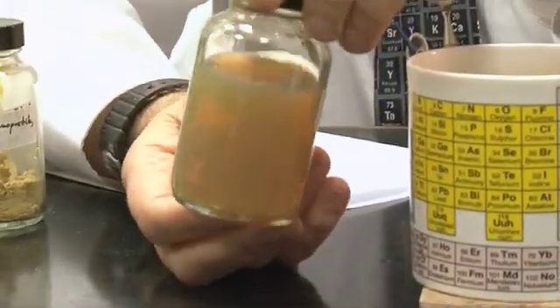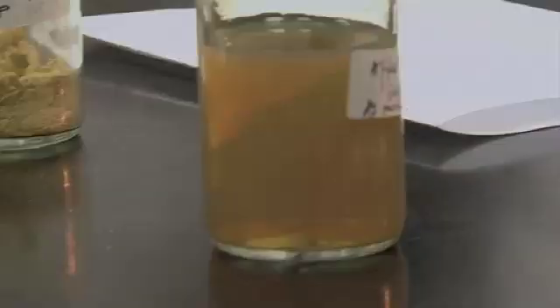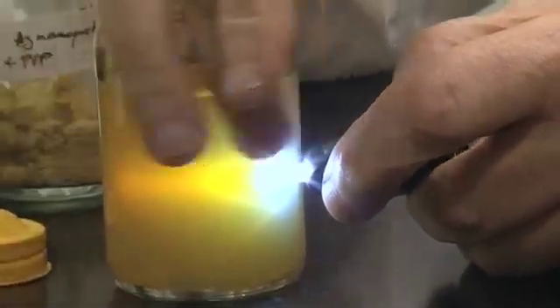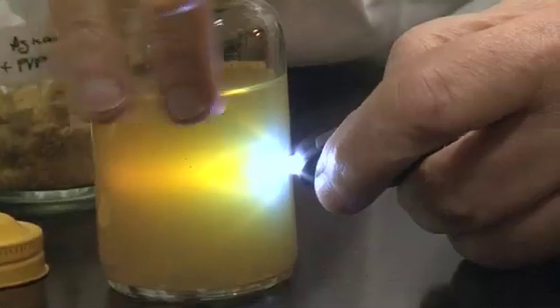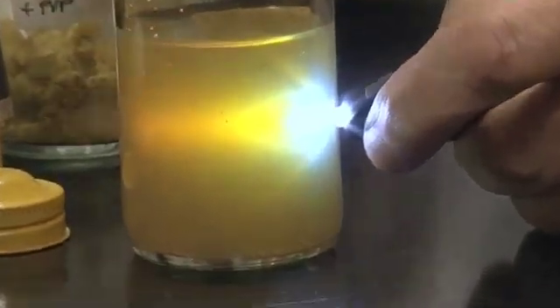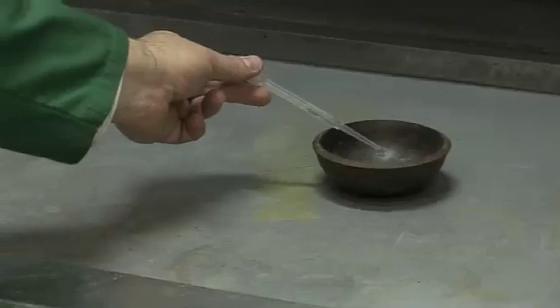Here I've got a solution of silver nanoparticles — you can see it doesn't look silver, it looks a bit yellow actually. You can tell it's got particles in it because if I shine a torch through it, you can see the particles better. If you look at the light you can see a cone of light that looks rather like the headlights of a car in fog. This effect is called the Tyndall cone, indicating very tiny particles suspended in the solution — not silver dissolved in water, but actually very tiny particles. So let's start the reaction with just a little bit of water. Wow!